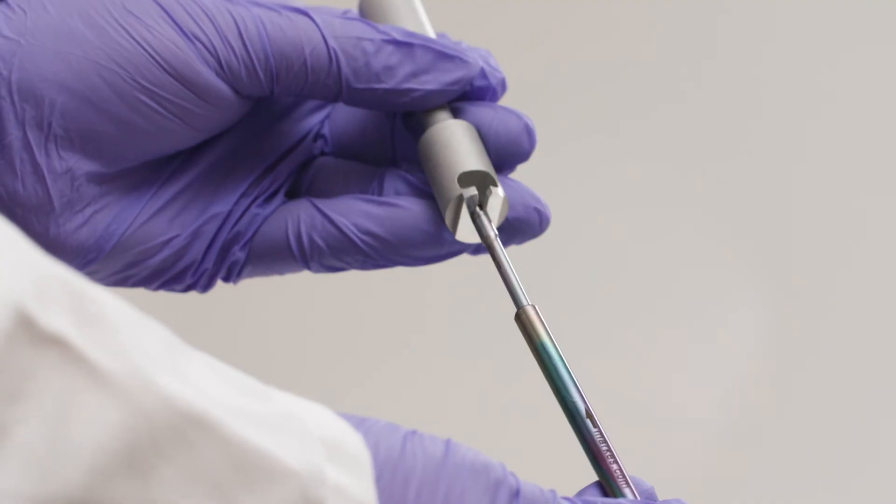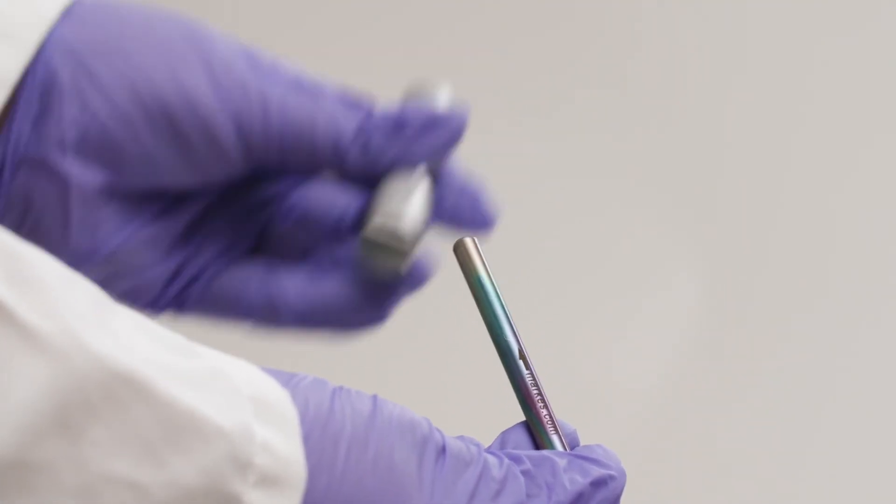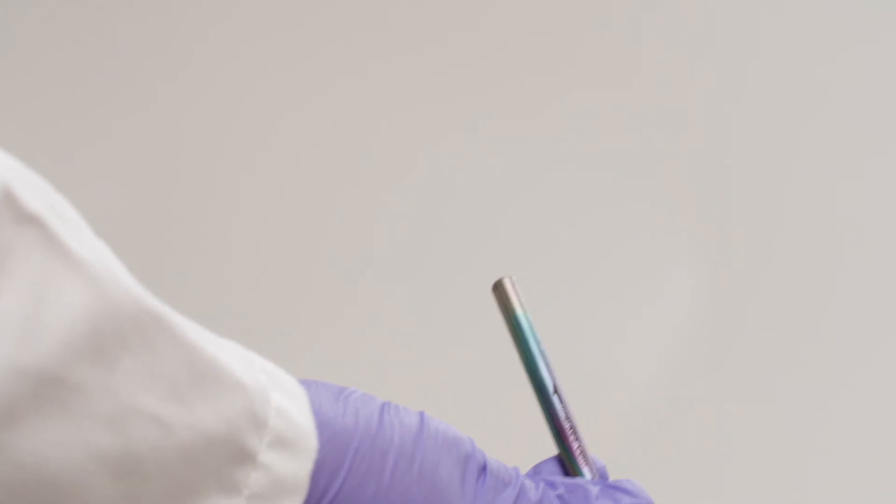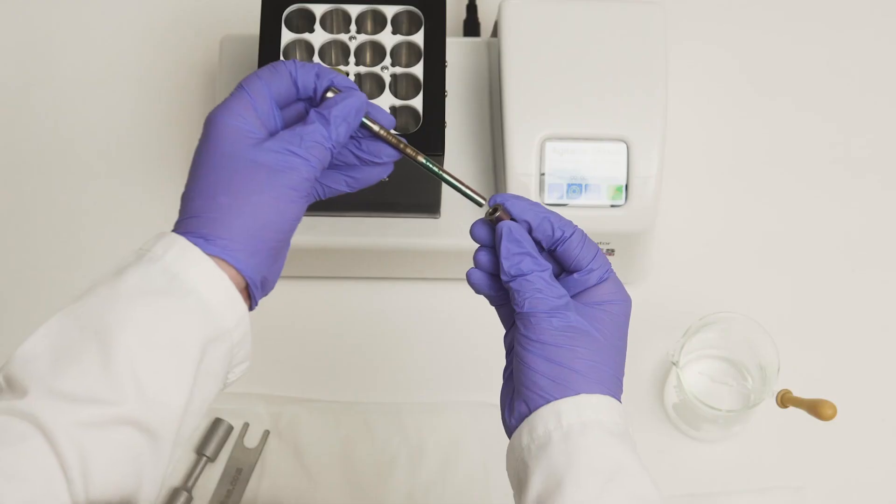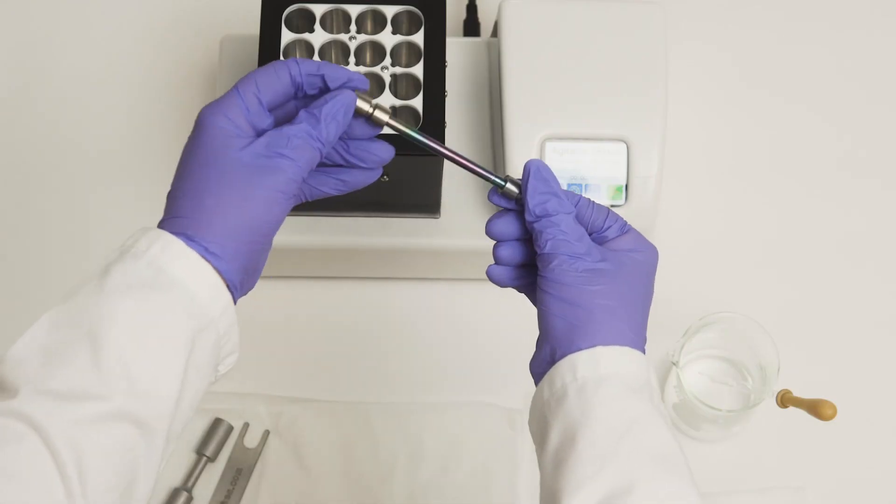Finally, insert the probe into an empty, industry-standard sorbent TD tube, either metal or inert. Add caps to secure the sample. It's now ready for analysis.